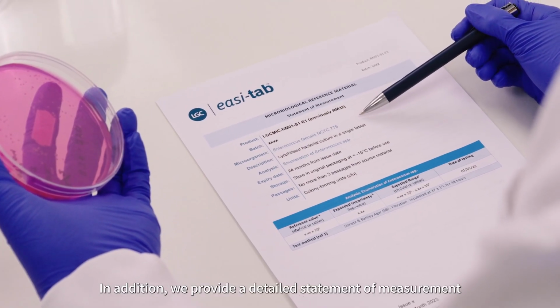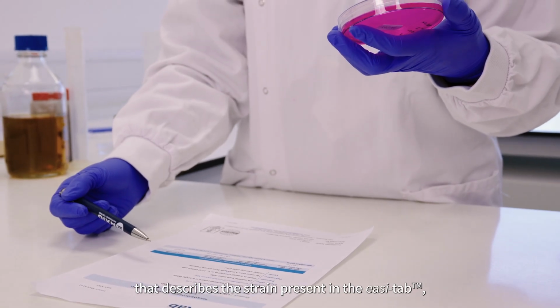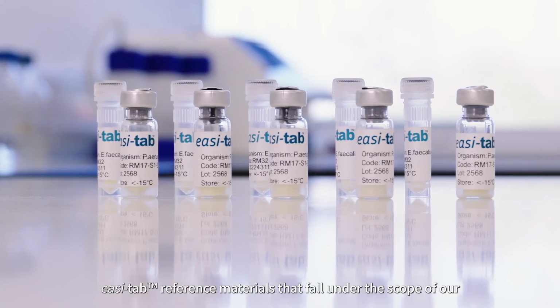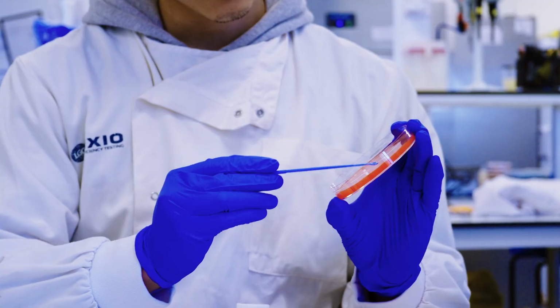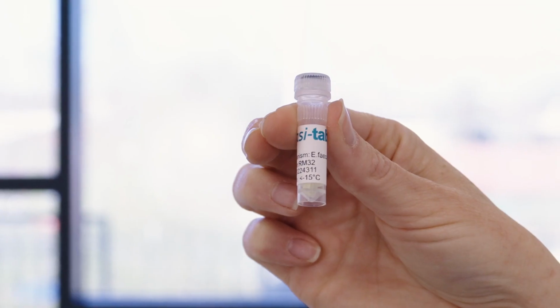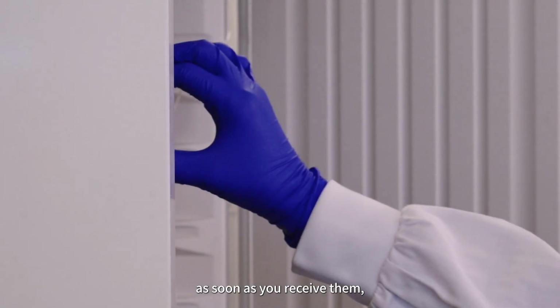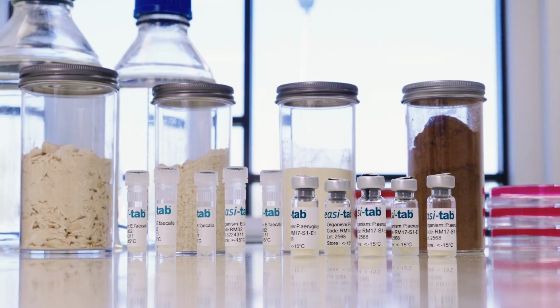In addition, we provide a detailed statement of measurement that describes the strain present in the easi-tab, its reference value and expected measurement range, and date of production. easi-tab reference materials that fall under the scope of our ISO 17034 accreditation also include the UKAS accreditation mark on their statement. To ensure their stability, easi-tab products should be stored in the freezer as soon as you receive them, and most can be used for up to 2 years after their production date.